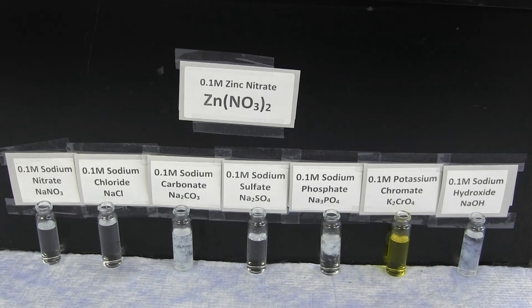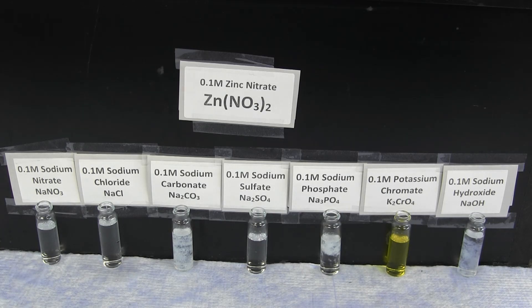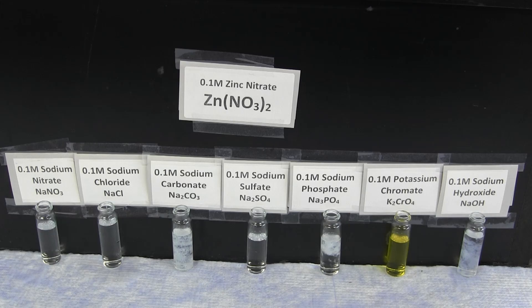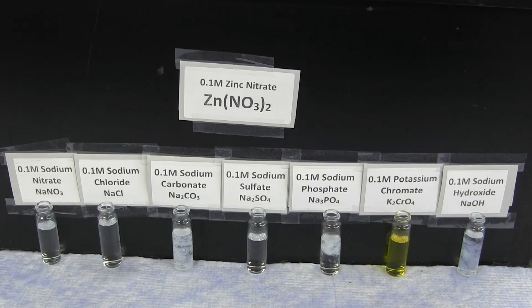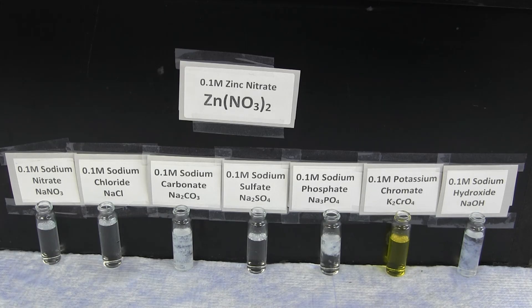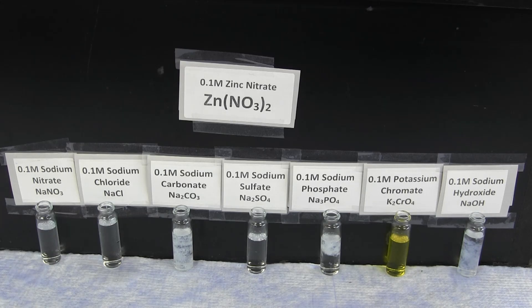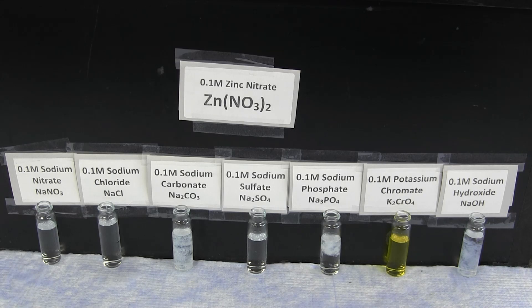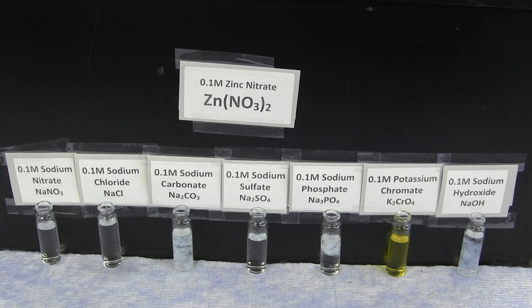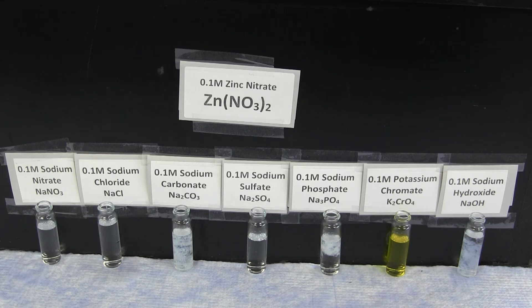Using the different observations of the known metal ions, you can then identify the compound of your unknown based on the precipitation patterns.